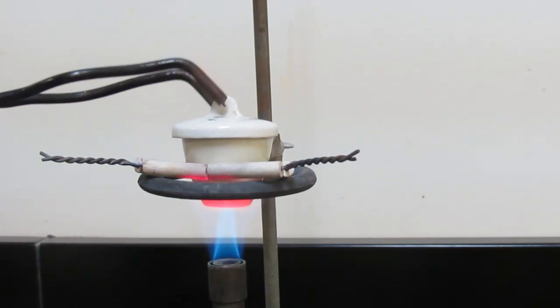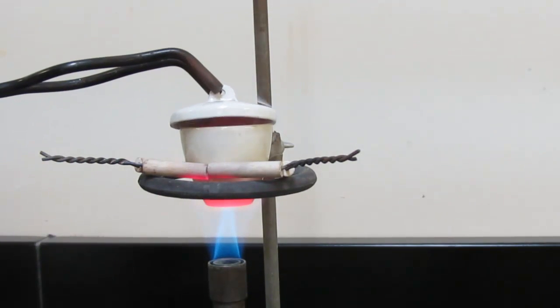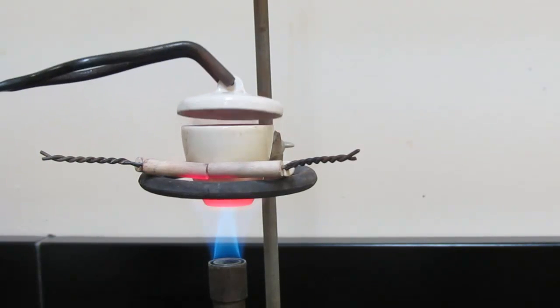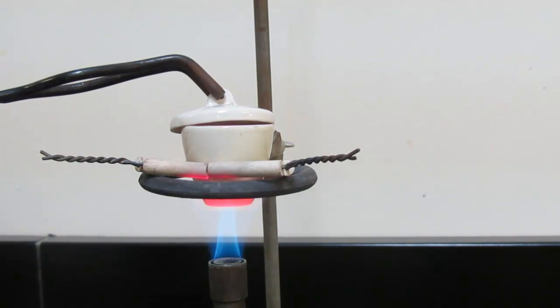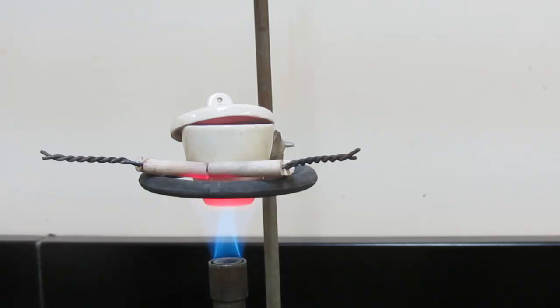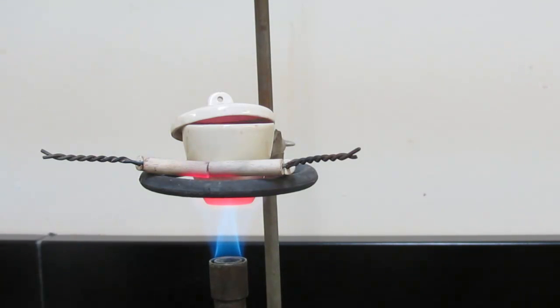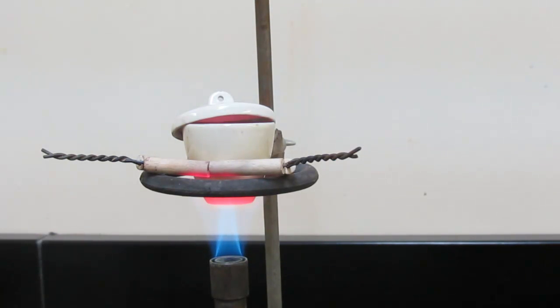Okay, we'll tilt the cover and we'll heat for an additional couple of minutes. It's still reacting quite vigorously in there. We'll let some more heat in there. Leave that cover open just a crack. We'll allow it to heat for another minute or so. Okay, in the interest of time, let me go through what we'll be doing here in just a moment.